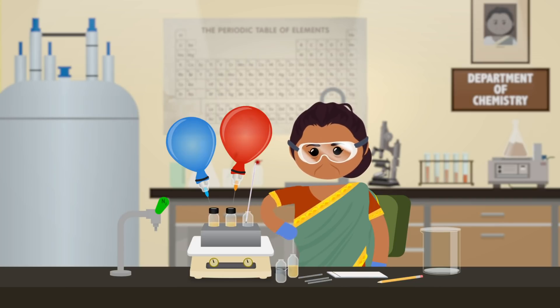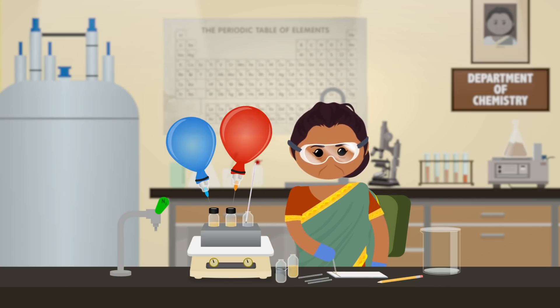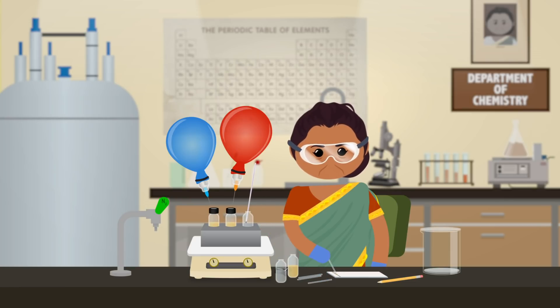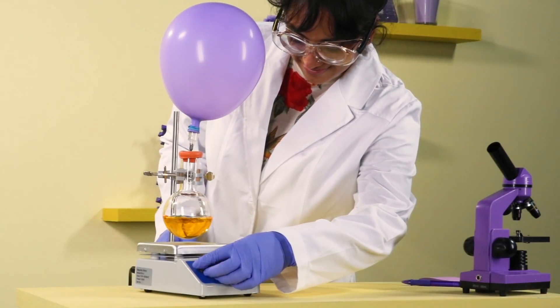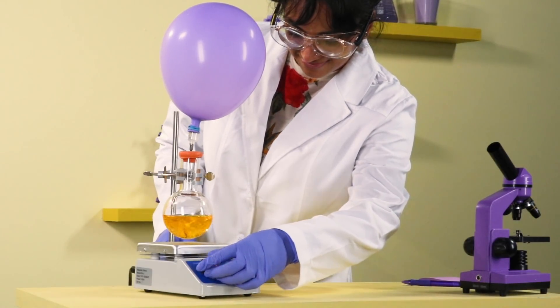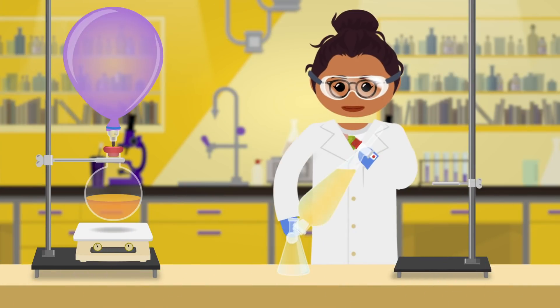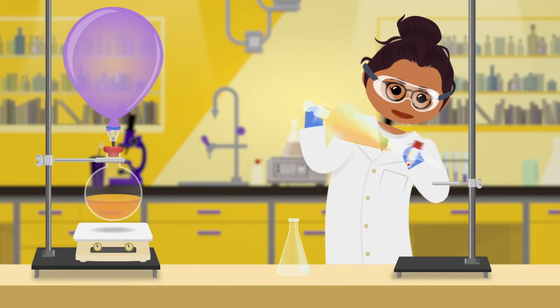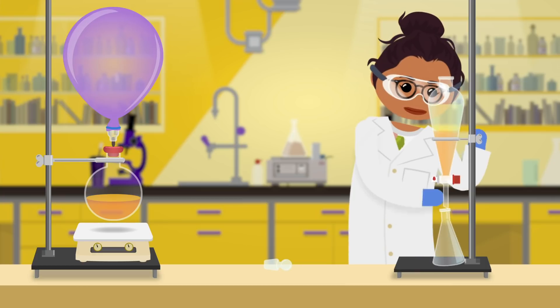And if TLC looks promising, they may take a proton NMR of the unpurified reaction mixture to check for characteristic product peaks. Next, the chemist will scale up the best reaction to make a larger amount of product. When the reaction is done, they'll work it up, which is lab lingo for performing an extraction to remove some side products based on solubility.